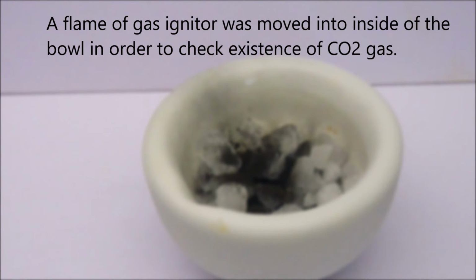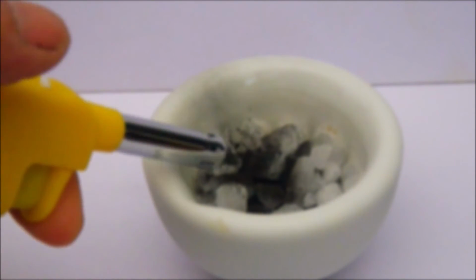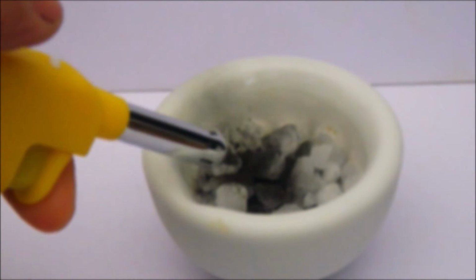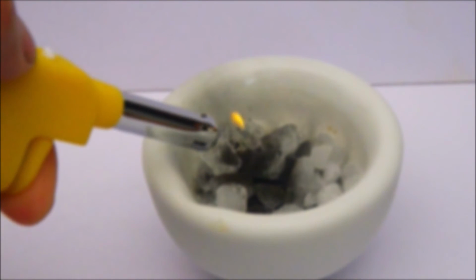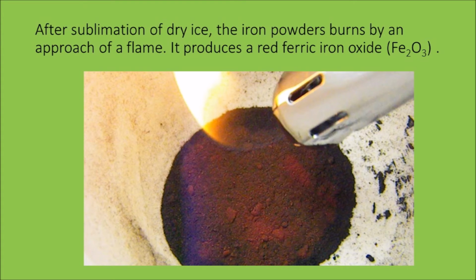A flame of a gas igniter was moved into the inside of the bowl in order to check the existence of carbon dioxide gas. After sublimation of dry ice, the iron powder burns by the approach of a flame. It produces a red ferric iron oxide.